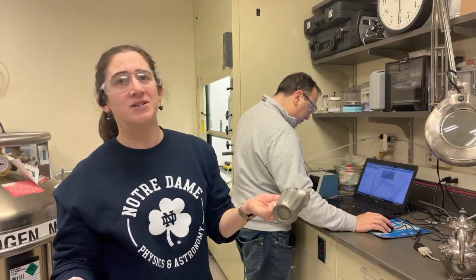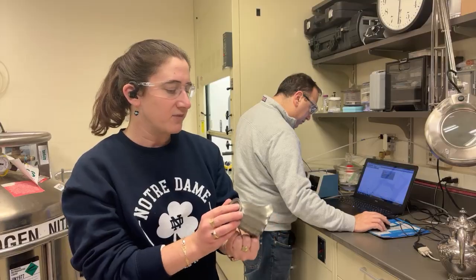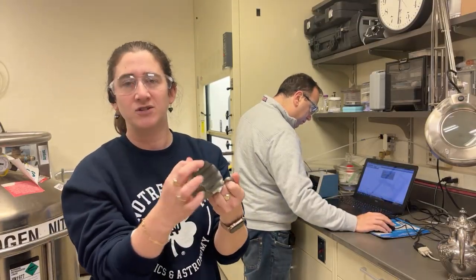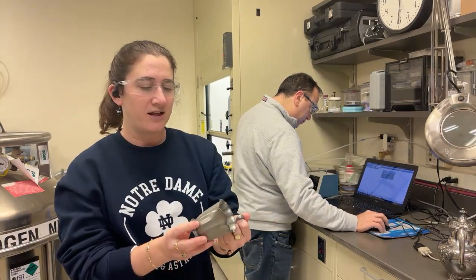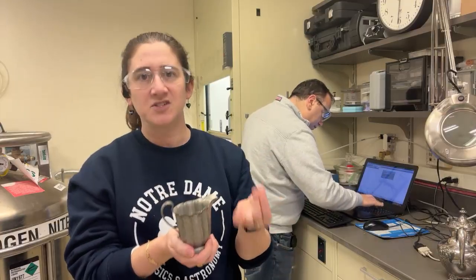That sounds pretty time intensive. I think there are also some other experiments that we could do that might or might not be destructive, that would actually take a small amount of this and analyze what fraction of the atoms in a small sample are tin versus copper versus lead.